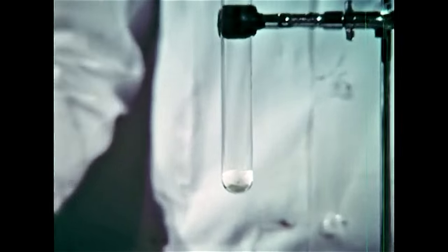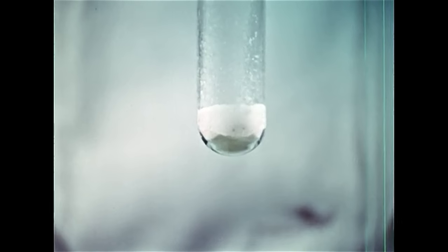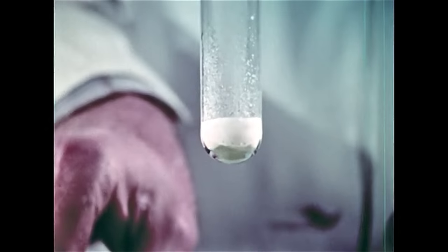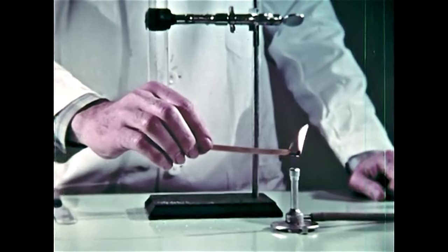The clear greenish material at the bottom is sodium peroxide the water hasn't reached. Above it is sodium hydroxide solution mixed with bubbles of oxygen gas, and above that should be nearly pure oxygen.